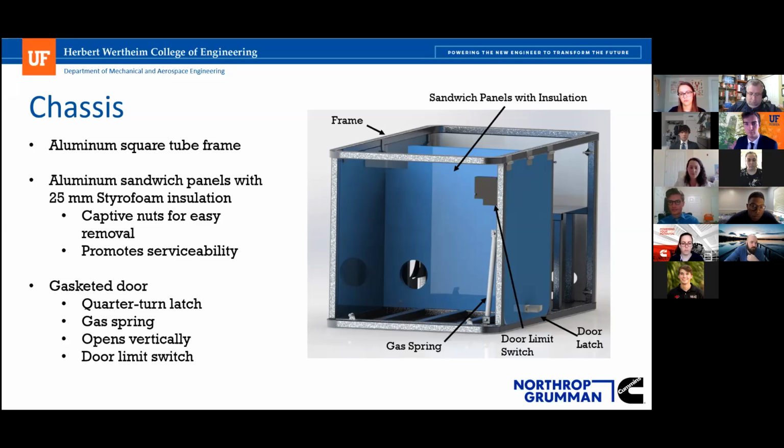The main point of access is a single door that has a 1/4 turn latch and a gas spring. It opens vertically to not upset the bounding box of the machine, as well as disrupt table space or something like that to move from the side. It's got a door limit switch on the side, which is pictured there, so that the system shuts off when the door is open to provide another level of safety. A few other things here.